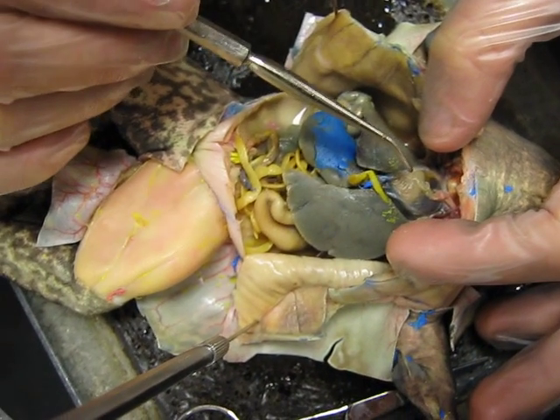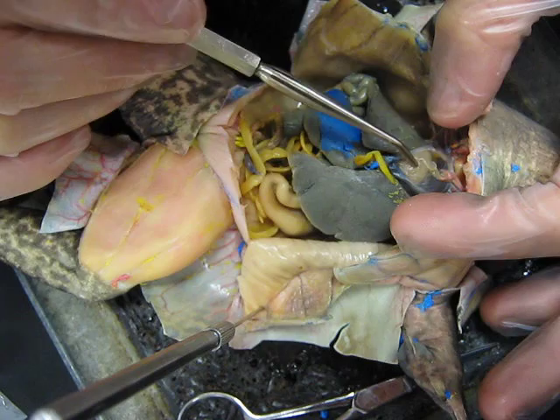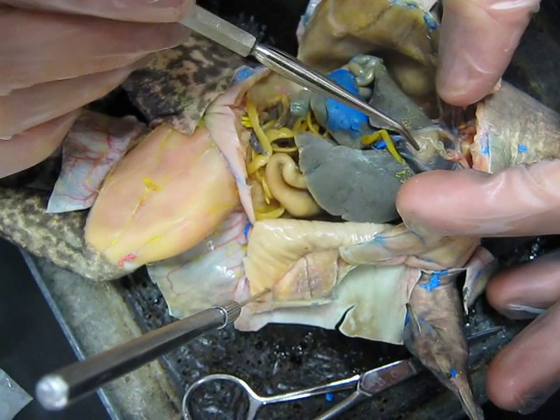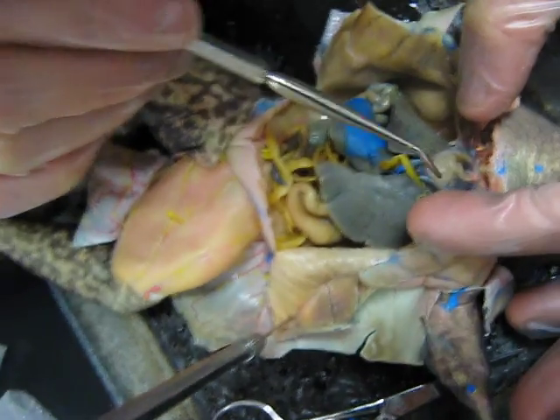This is the frog internal anatomy. This is the heart, the left and right atrium, and this is the ventricle. The heart is enwrapped in the pericardial cavity.